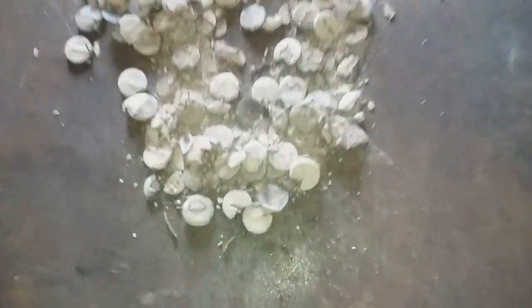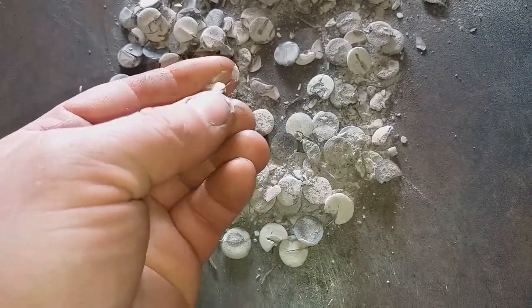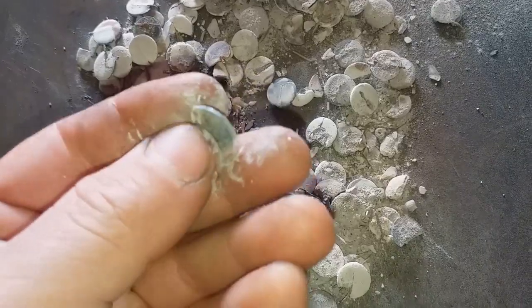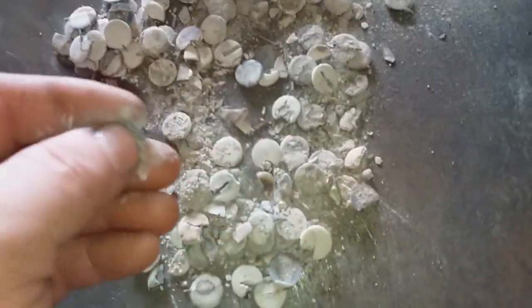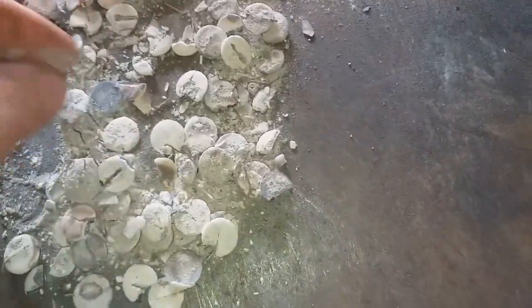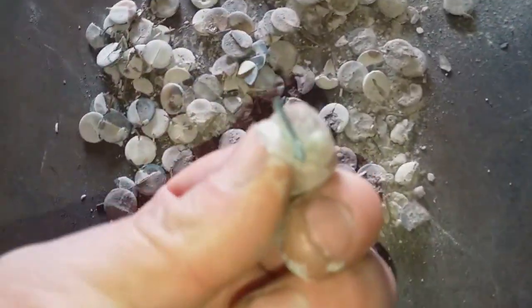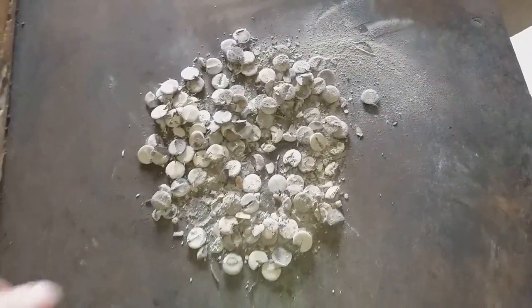I burned the capacitor - it's very crunchy right now. When you remove that epoxy, you get inside a disc like this. I will remove all that epoxy; it's very easy, just a little pressure and everything is removed. Right now I will crack all of that and process it in the nitric acid, because inside the disc there probably is some noble metal.